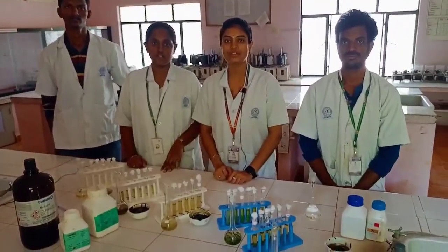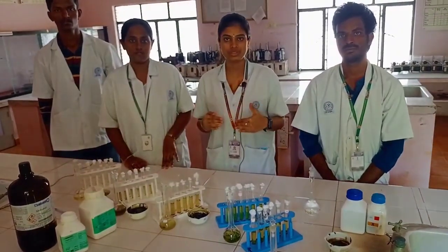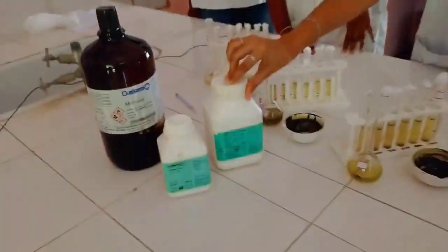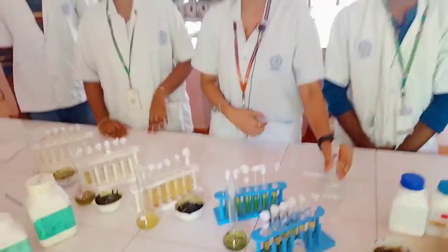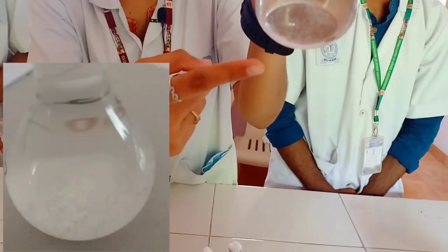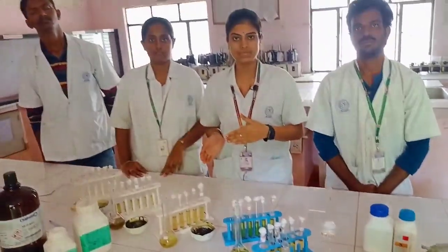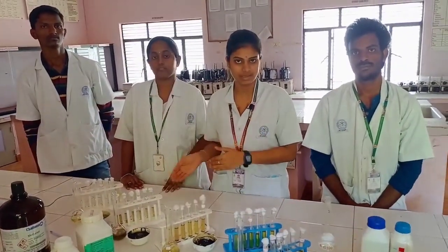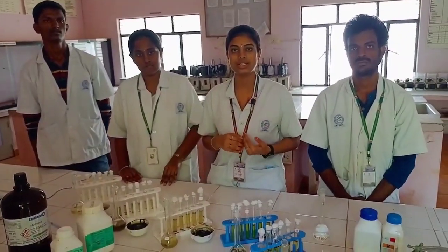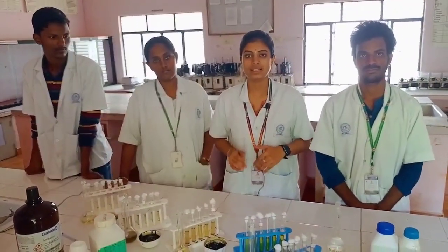I am Rajeshwari from 4th year B Pharmacy. I am going to explain about the aggregation assay. In the aggregation assay, we take tris buffer and add CaCl₂ and sodium oxalate, then keep it aside overnight for the formation of crystals. As we can see here, by keeping it overnight we can observe the crystal formation. Now take a few mL of this solution into different tubes and add 1 mL extract of different concentrations of different medicinal plants. Keep aside for 30 minutes and observe the absorbance using UV instrumentation. By that, we can calculate the percentage inhibition of calcium oxalate crystals.